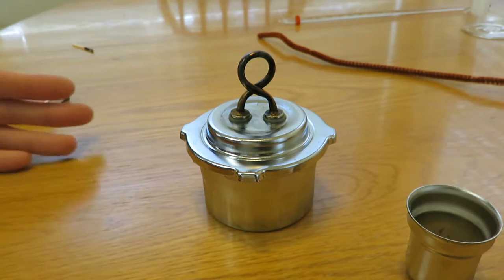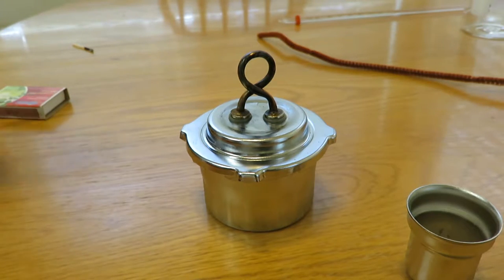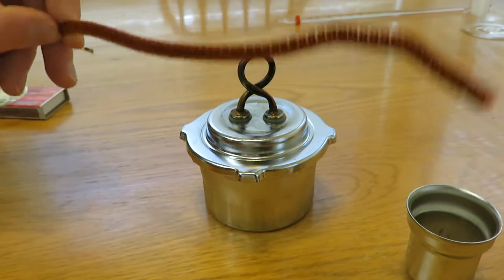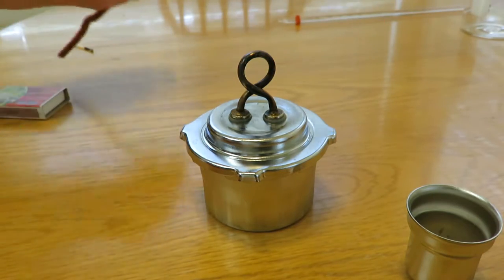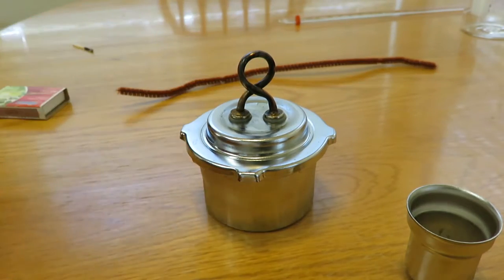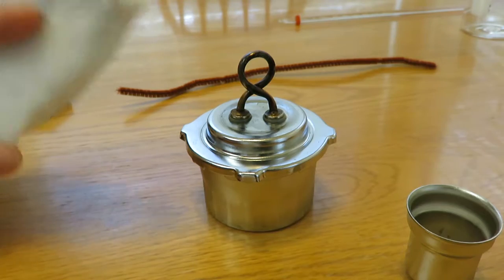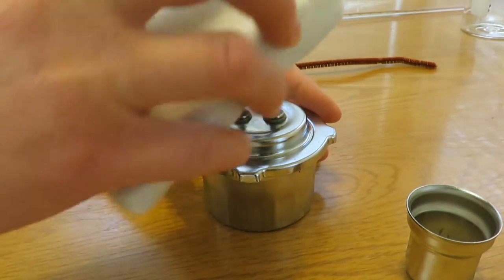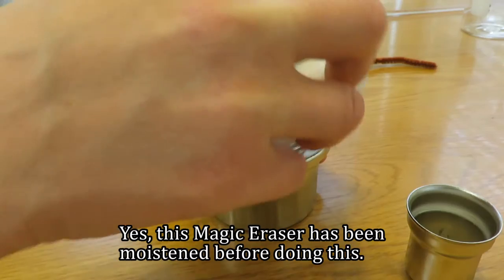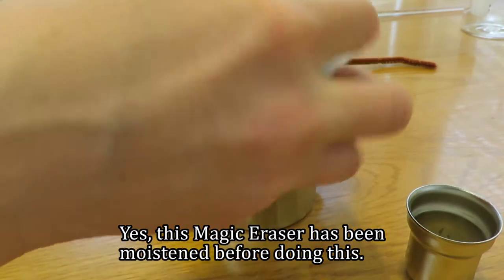I'm going to try a pipe cleaner because I'm not quite sure. I haven't pulled this off to look, but we're going to see if the magic eraser cleans it up. Probably should have looked into it sooner, but I didn't.